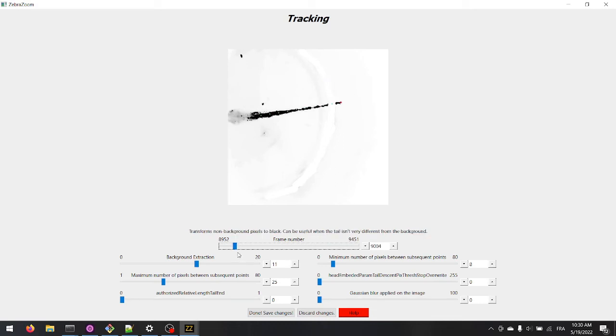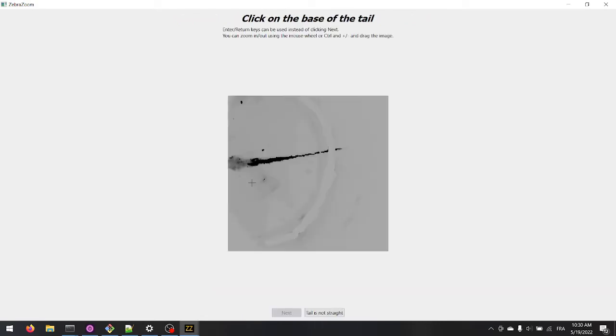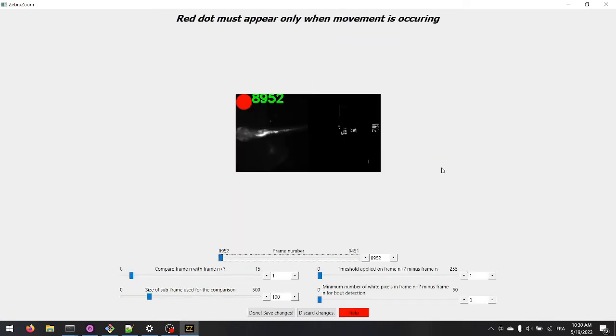When the tracking seems to be working well, go back to the previous page. Now you should adjust parameters to detect bouts of movements. In order to optimize the detection of bouts, adjust parameters for the red dot to appear on the top left corner of the image for every frame when the fish is moving. The red dot should not appear when the fish is not moving.